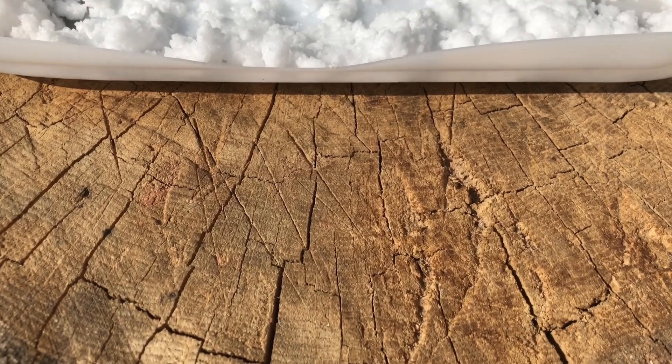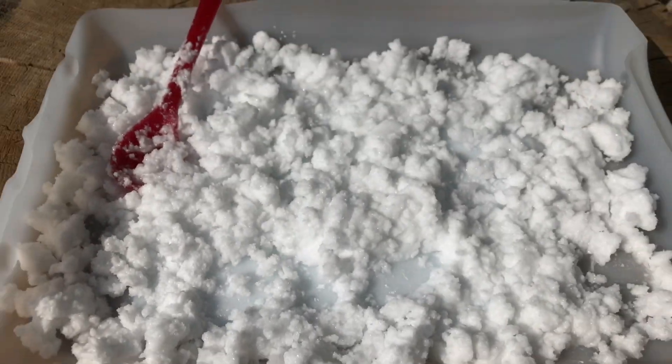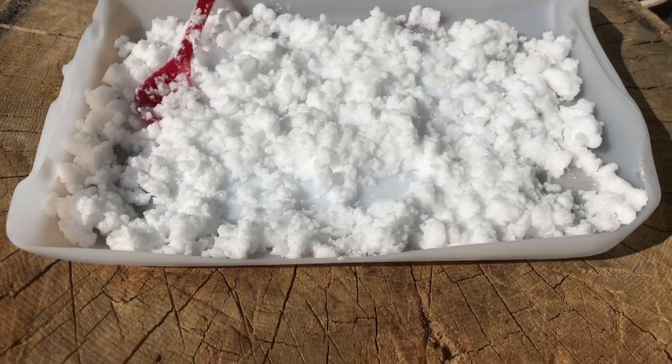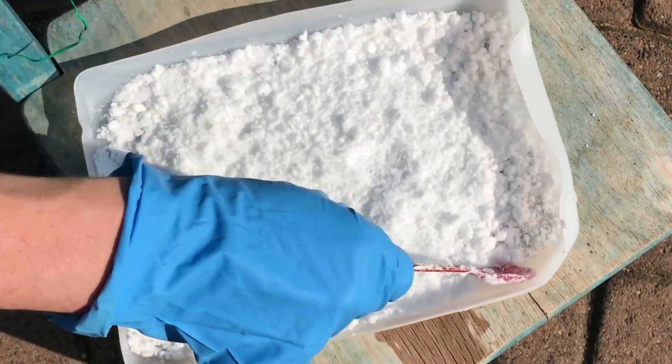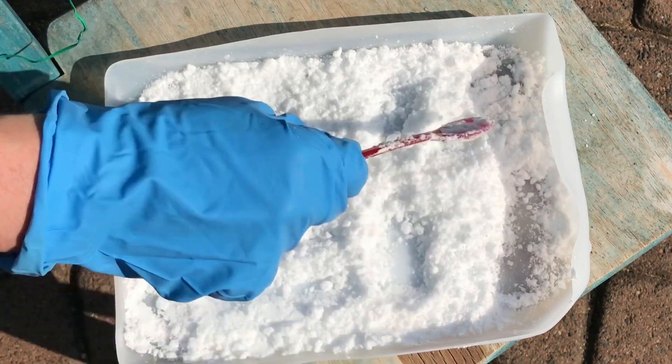While in the sun the product was drying quickly. While drying we mixed it up occasionally with a spatula to expose fresh surface. To speed up the drying process a little we put it into the sun a little more directly and put a fan next to it.